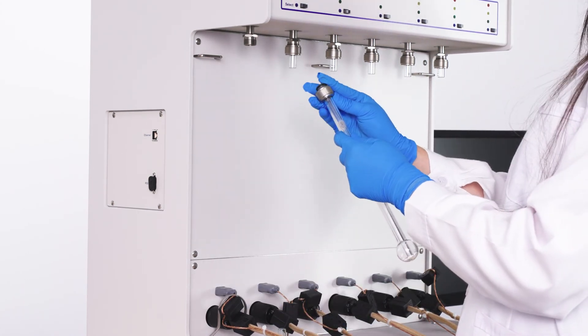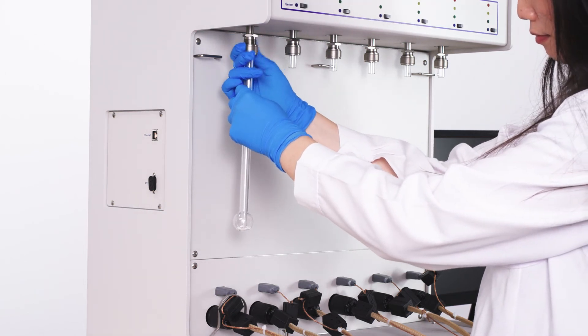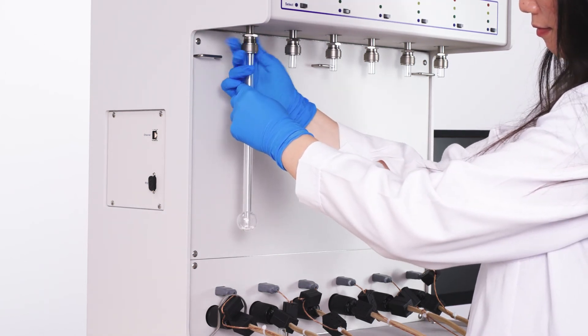Place the nut, ferrule, and o-ring on the sample tube. Then place the sample tube in the degas port and tighten the nut to secure.